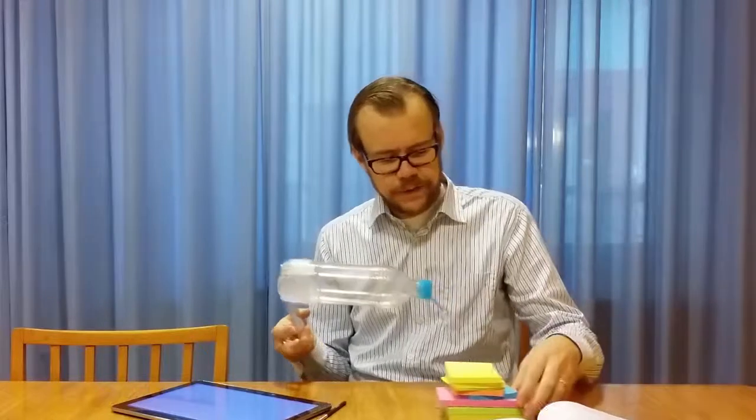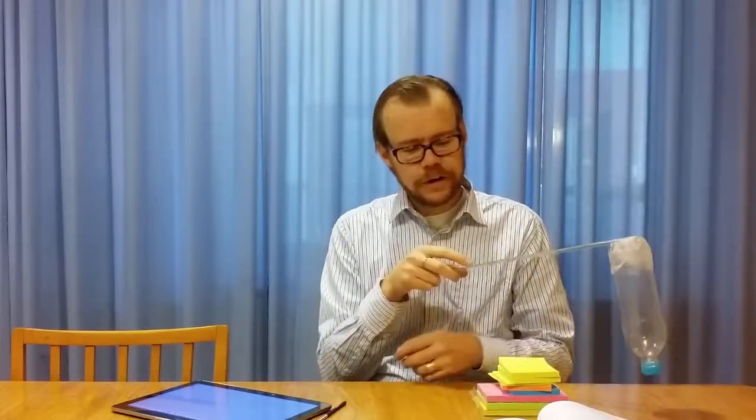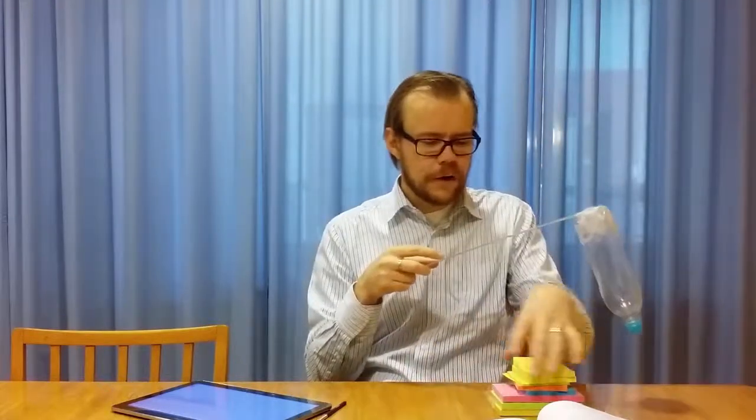The second artifact that you can have is the tip's influence on the sample itself. Let's say that you have a particle on the surface, and this pile of paper is our particle. If this is a small particle that's loose, then you scan this, you come up to it, and then you scan this, you come here, and then it follows along because you push it with the tip. And then it perhaps slides over. So then you see that the particle was pushed during the scan, and the interpreted image of that will be a long particle. It will look oval in shape here.